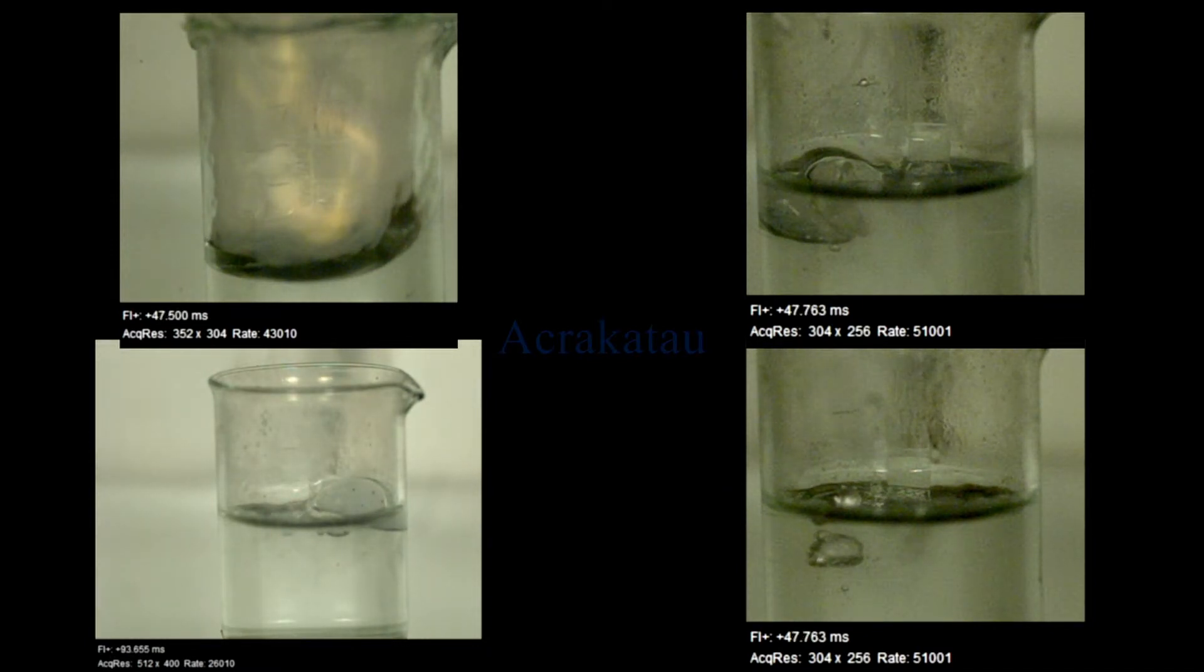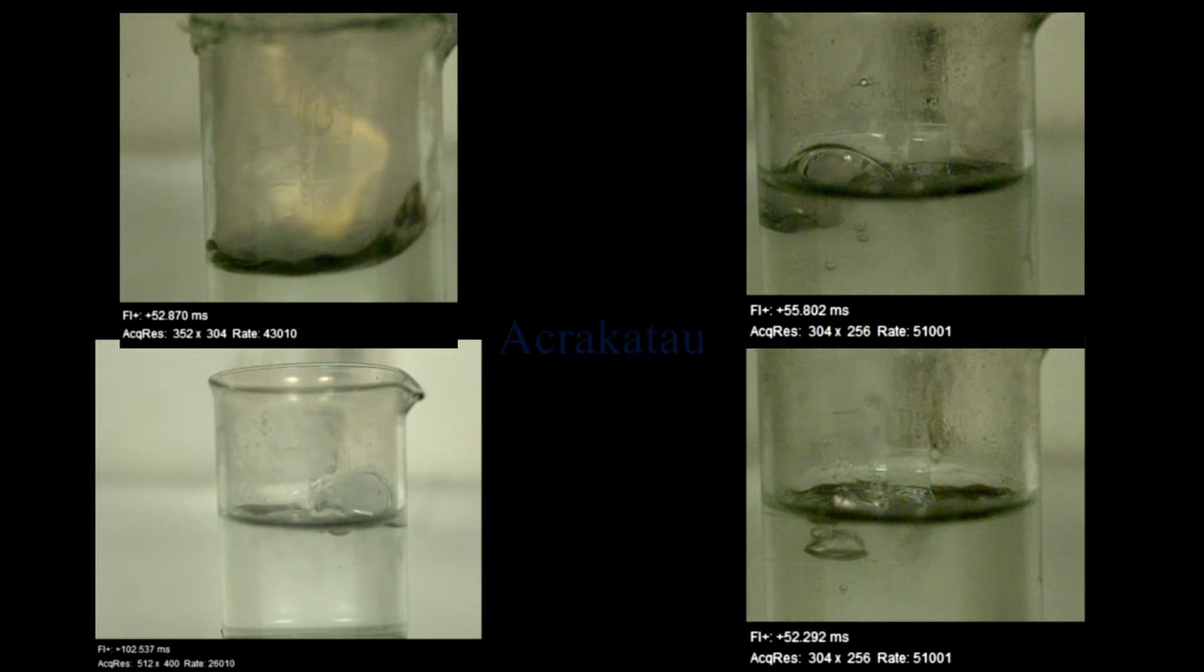You could see it very clearly in the upper right and the bottom left one. There the sodium did explode, but until now there was no flame.